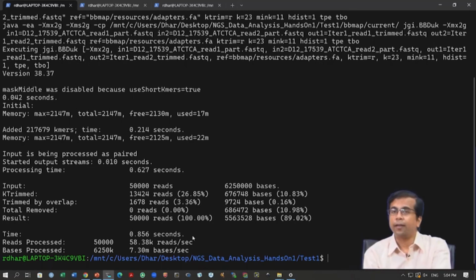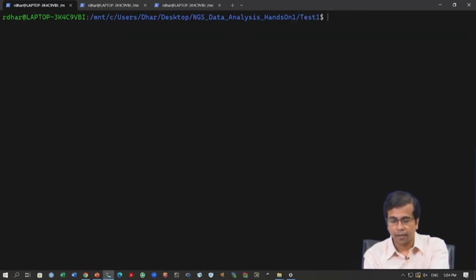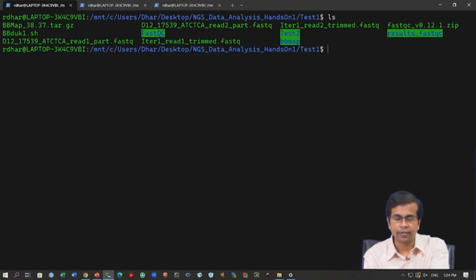Once this is done, the next step is to run it through the quality control pipeline. We want to check quality again. This is important because we want to make sure that these adapter sequences have been removed. So, let us do that, and here we will get the trimmed data. We have named these iteration 1 read 1 trim.fastq and iteration 1 read 2 trim.fastq.